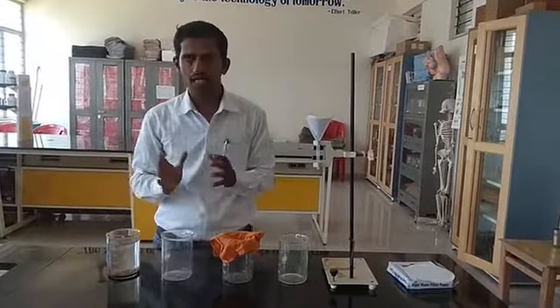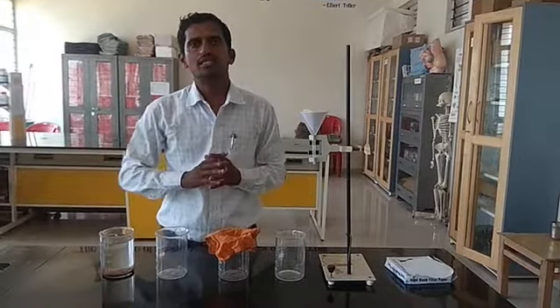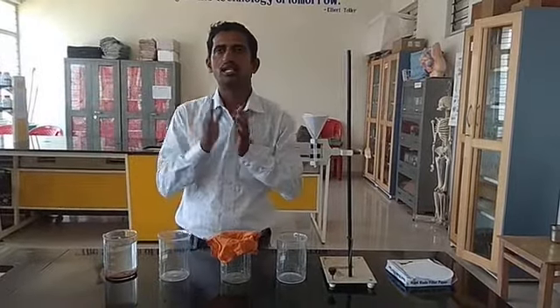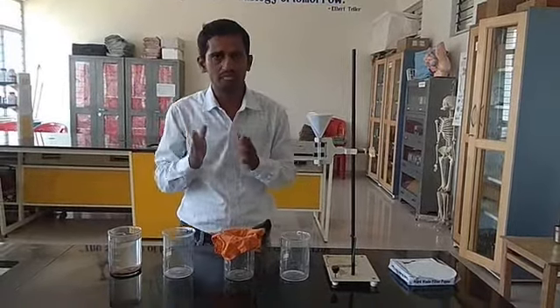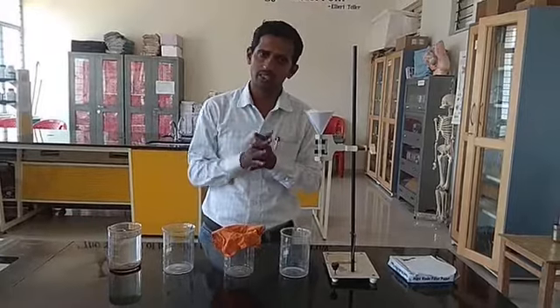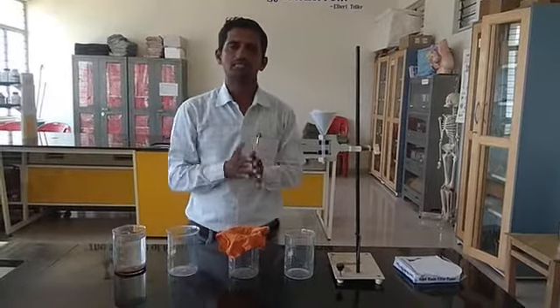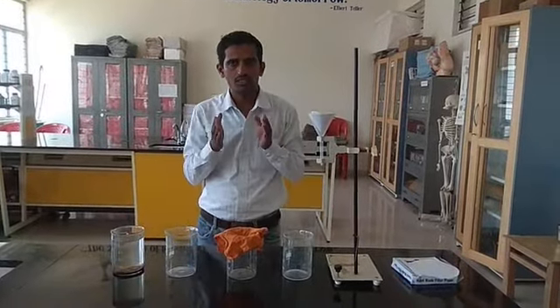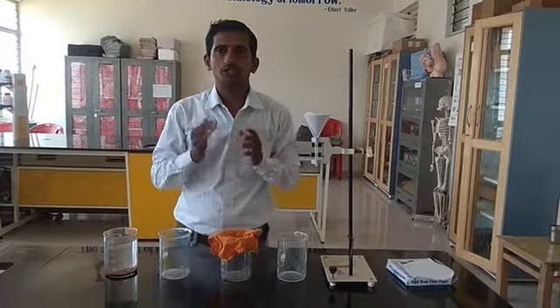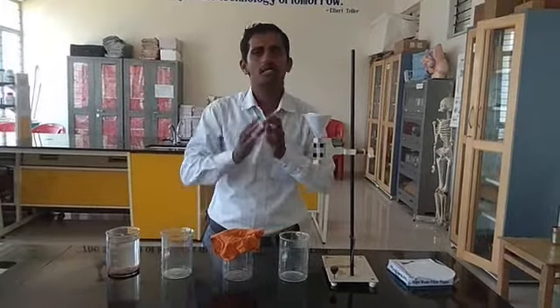In the first beaker, I have added some soil. Especially after rains, water gets mixed with soil and becomes muddy. Even tap water sometimes mixes with soil particles and becomes muddy. Water supplied from ponds and rivers through our taps is also often muddy — so it is not pure or safe water. A simple method we can follow is to tie a cloth over the tap so we get filtered, slightly safer water.